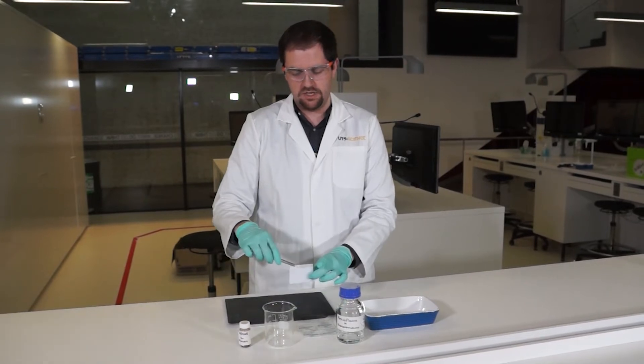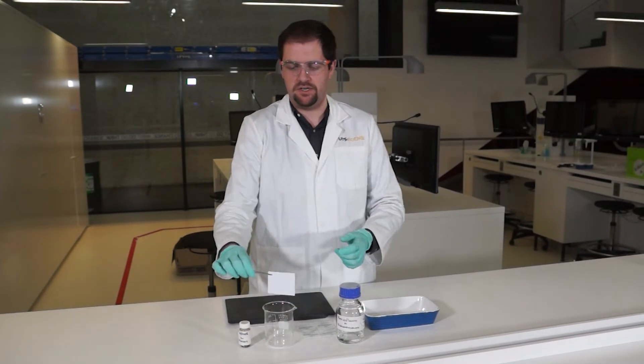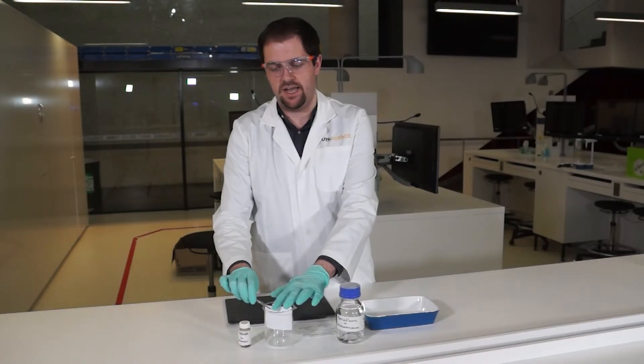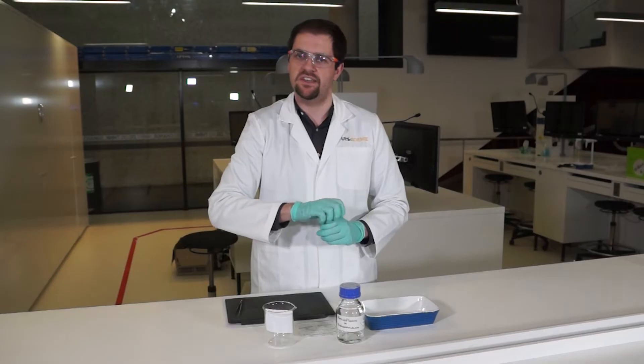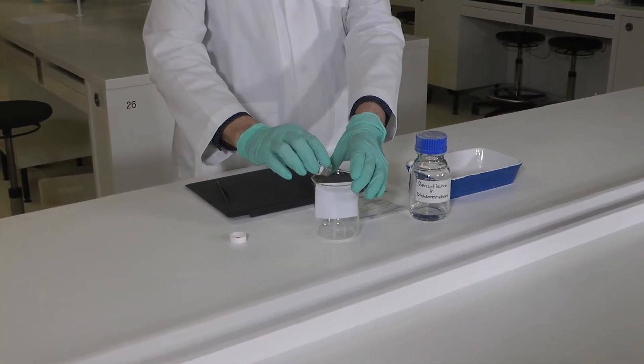We take a piece of paper that has some fingerprints already on it and place that into a beaker. Now we're going to place a small amount of iodine crystals in there.